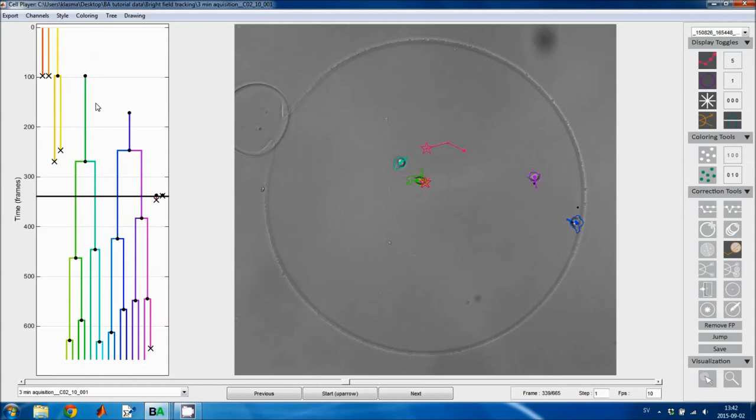And here we see that some of the links changed, and that's because we clicked inside regions, so that they had to be updated using a new segmentation. And when a new segmentation is computed, the ingoing links and the outgoing links of the new regions are relinked. This will normally save a lot of editing.